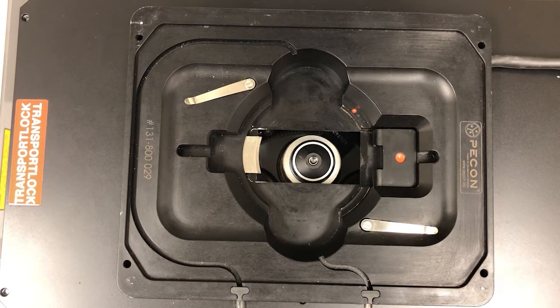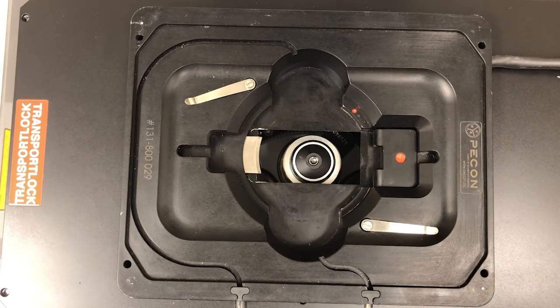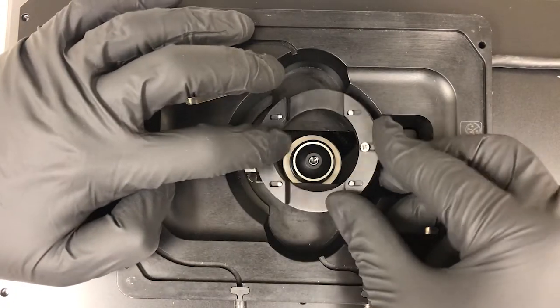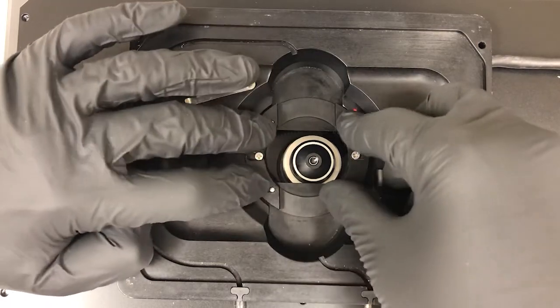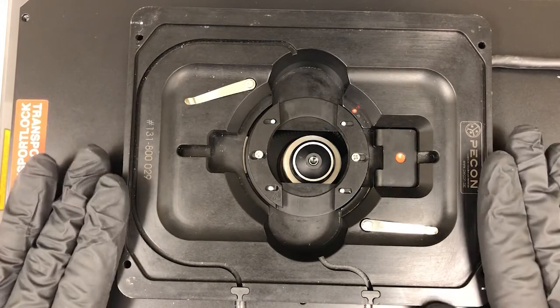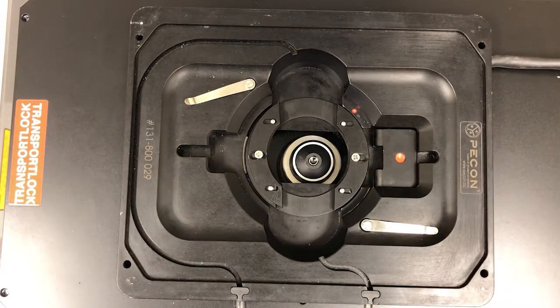So since we're going to use a 35 millimeter dish, I am going to put this adapter in. And we'll figure out if we need to screw this in later, okay? So there we have it. Just going to center this.